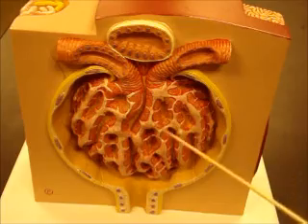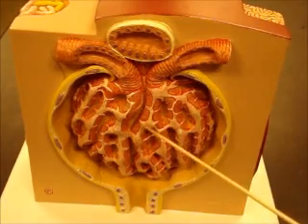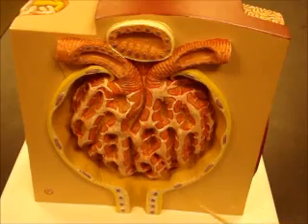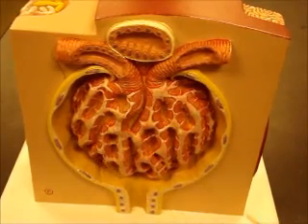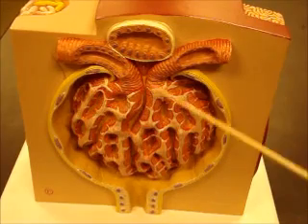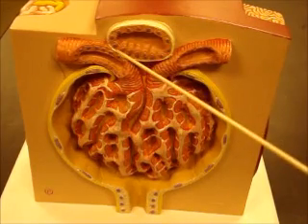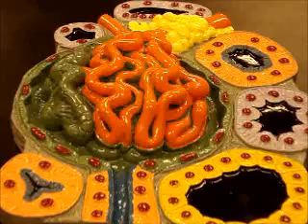These white cells are podocytes, and you can see their little feet, their foot processes coming off of there. Efferent arteriole leaving. Bowman's space, Bowman's capsule, proximal convoluted tubule, distal tubule, macula densa cells.